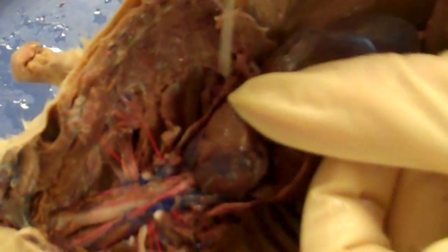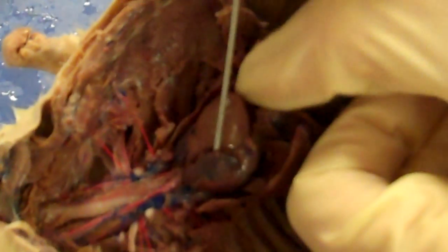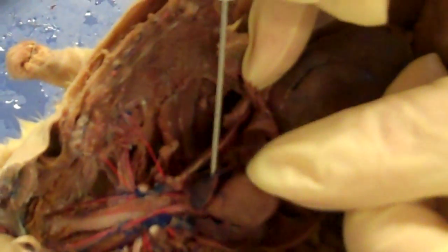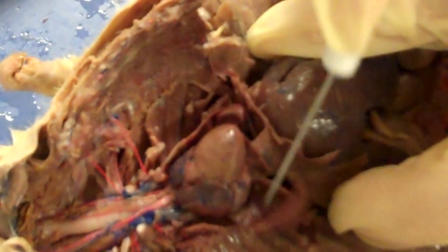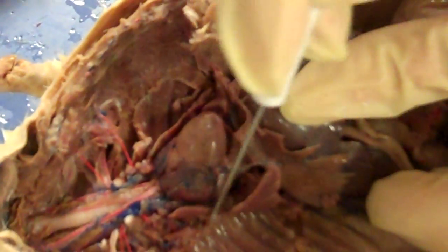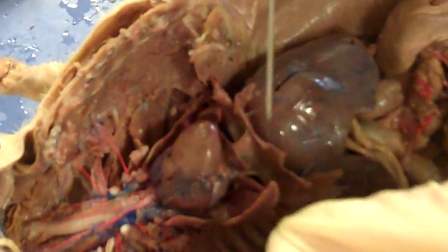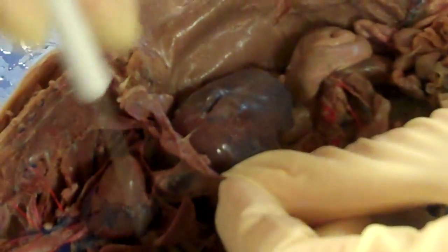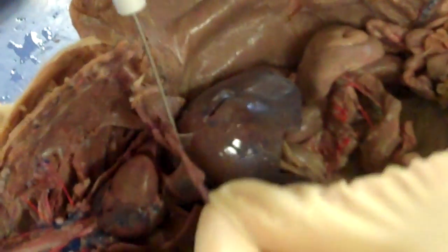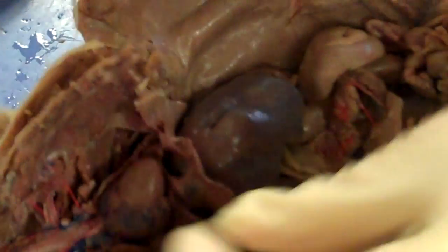Here's your four-chambered heart. This flap right here is the right atrium, and just below it would be the right ventricle. This flap is the left atrium, with the left ventricle just below it. These are lungs on either side of the heart — you have four lobes on the right side and one on the left. This sheet of muscle is the diaphragm, which separates the thoracic cavity from the abdominal cavity and is also involved in inflating the lungs during breathing.